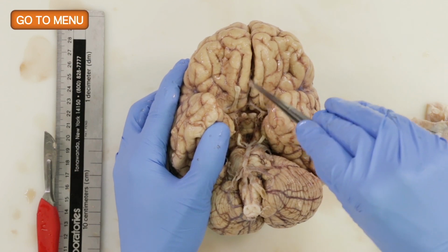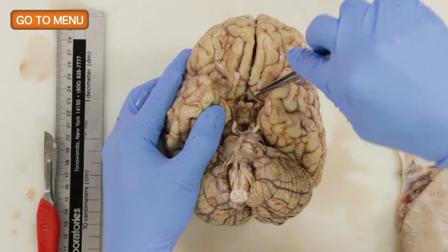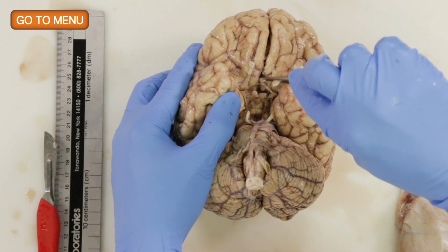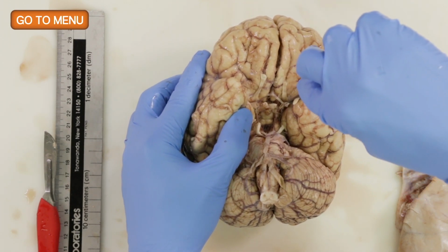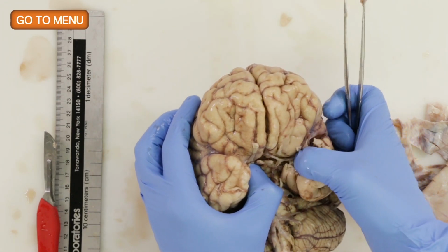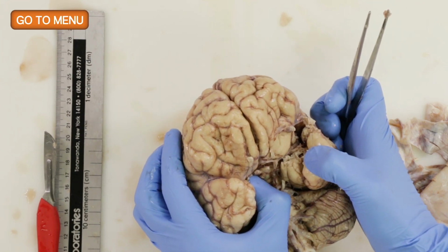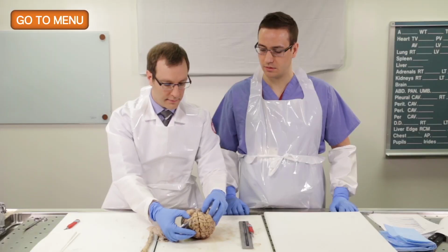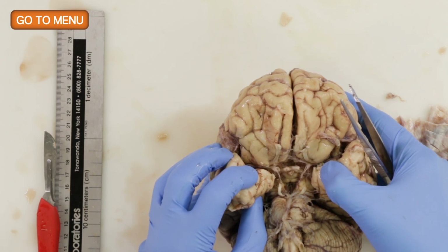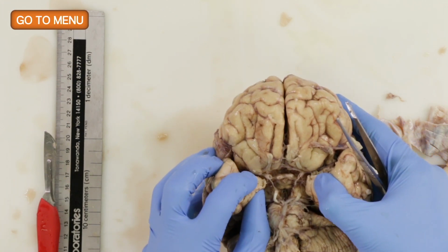So we have to pick away at the leptomeninges here a little bit. But we can see in this region, this is actually the anterior communicating artery right here, and these are the anterior cerebral arteries. This is the internal carotid. And then to get a good look at the middle cerebral arteries, we should dissect and pull away a little bit at the Sylvian fissure to take a look at that artery. So I don't see any aneurysms. We've already documented the extent of atherosclerosis, and if you do see significant lesions, you want to take sections of that artery in that area, but we don't.